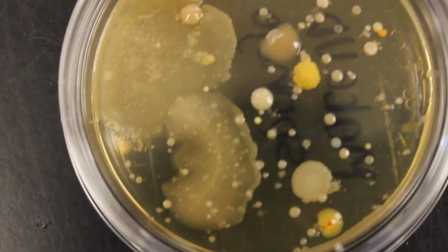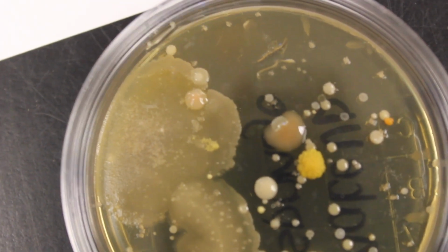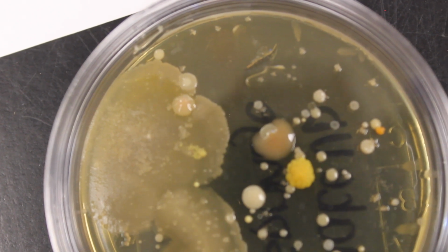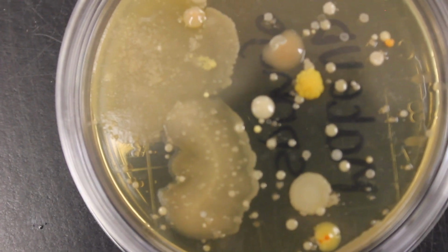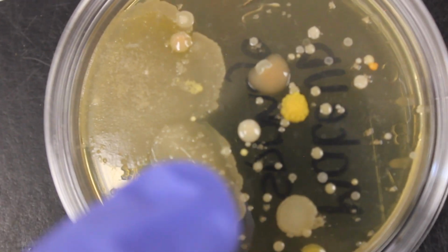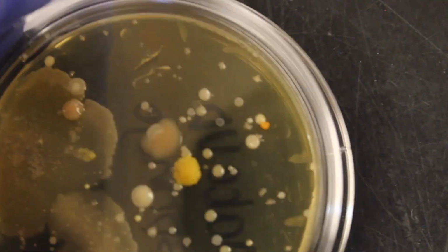We can look at our makeup sponge. All of these are bacteria on here. Each circle then is a colony. The colony was formed by a single bacterium which then duplicated into the whole colony. The original bacteria were called colony forming units, or CFUs. Here's a nice spreading colony here, and then here are your normal circular colonies.